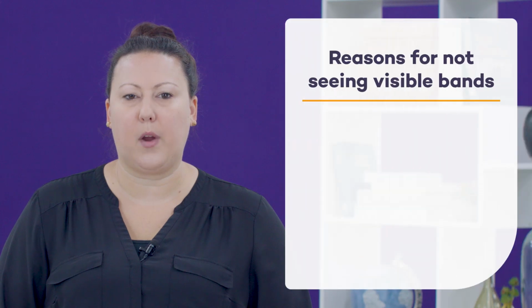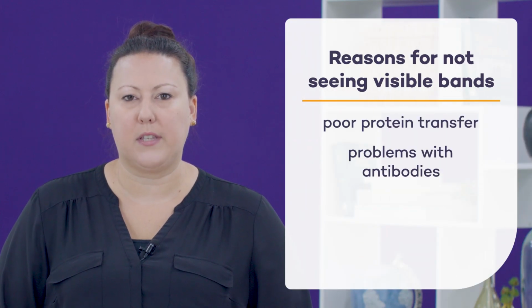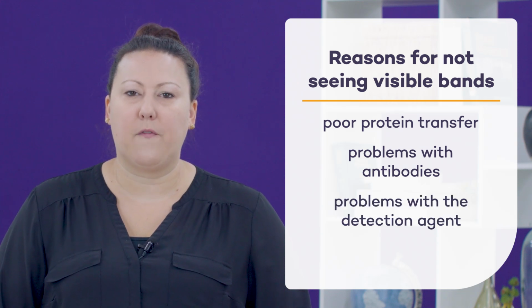There are three main reasons for not seeing visible bands on your membrane: poor protein transfer, problems relating to the primary or secondary antibody, or problems with the detection agent. To confirm protein transfer, stain your membrane with a total protein stain, such as LI-COR's Revert total protein stain. For more information, refer to the Transferring the Proteins Lambda U course.